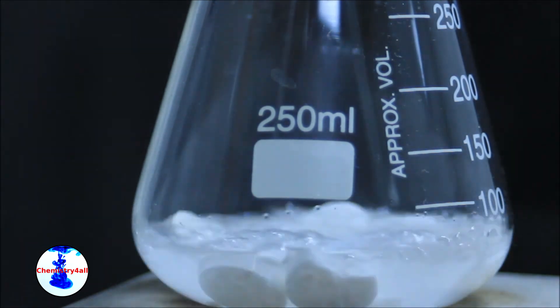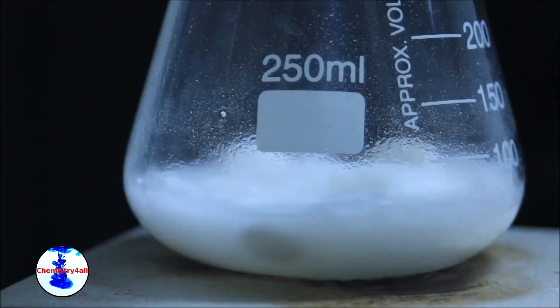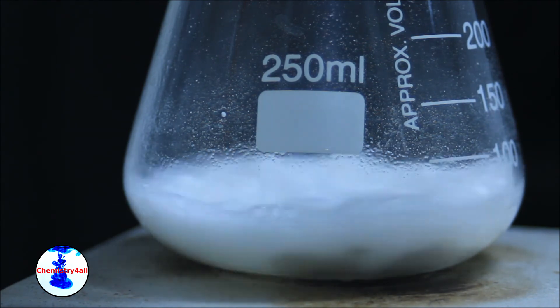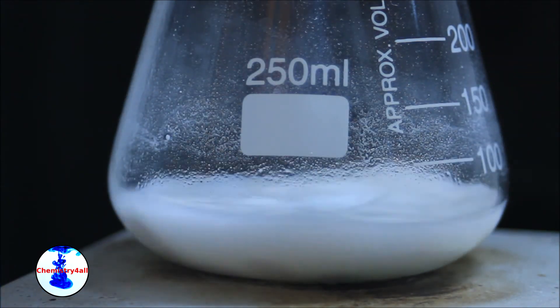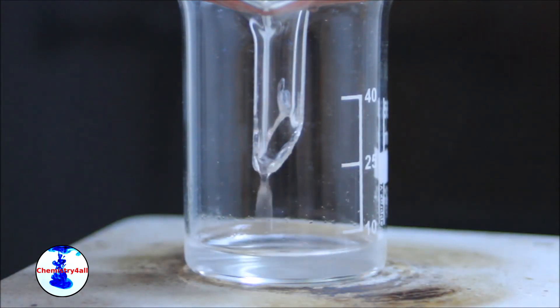You can clearly see how the system starts to reflux after being heated for a while. Just as before the system is allowed to cool down and then it's filtered to remove the solid residue left behind.